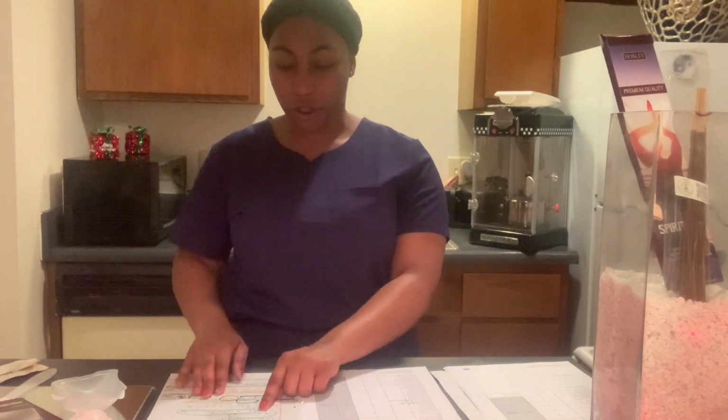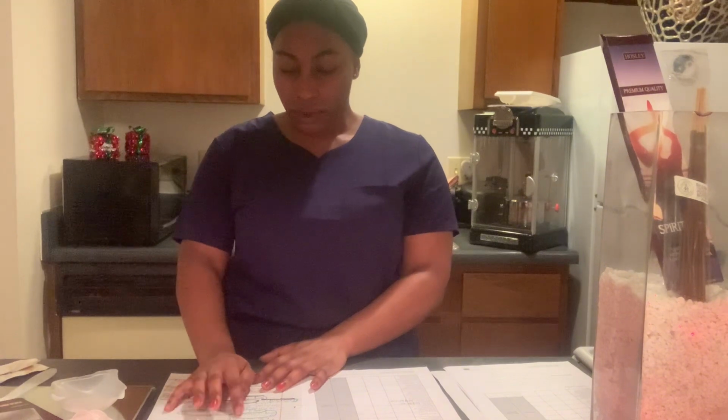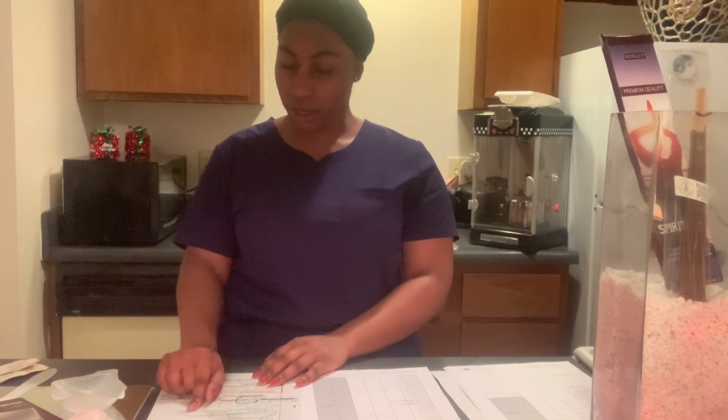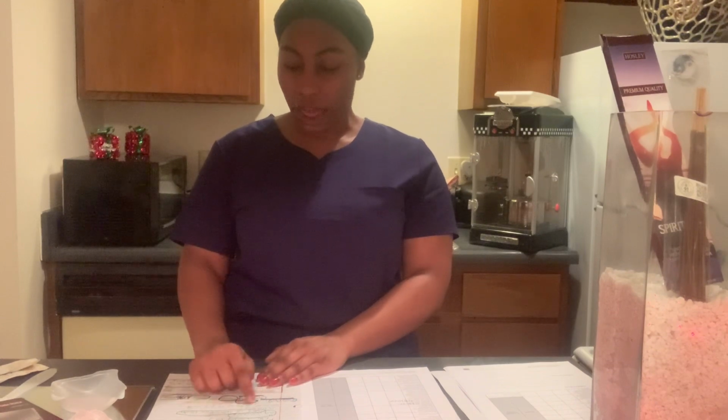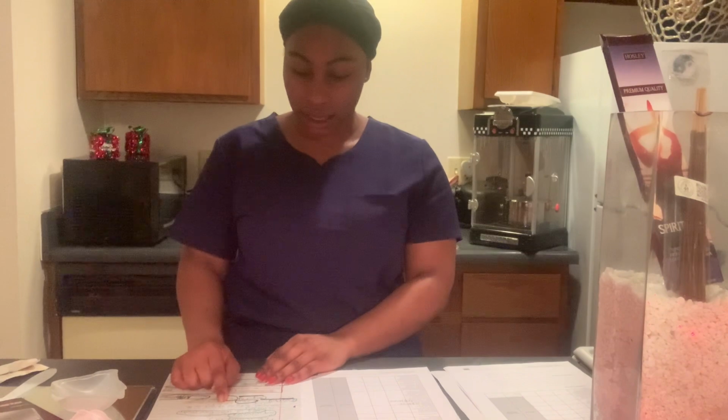So that's where we got the 30 grams from. And then 1.5 grams of testosterone powder is needed, because 5% of the 30 grams is the active drug needed.